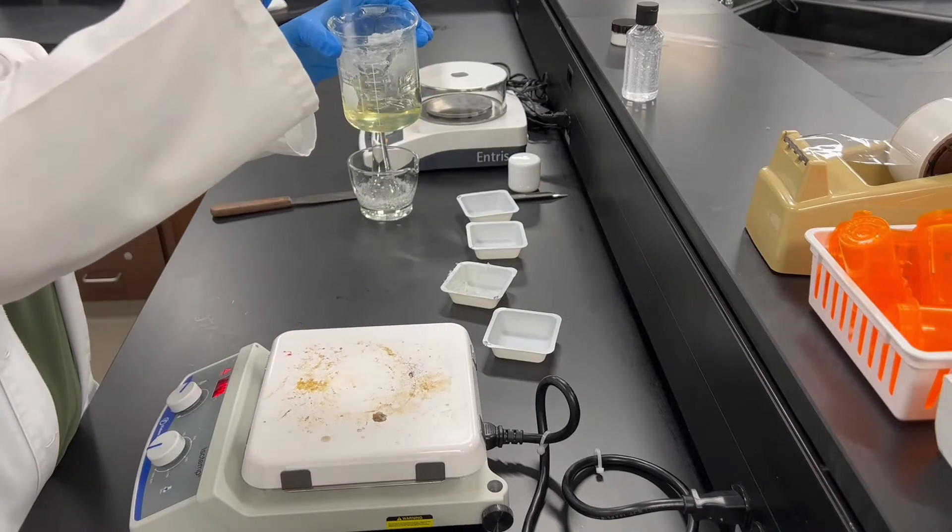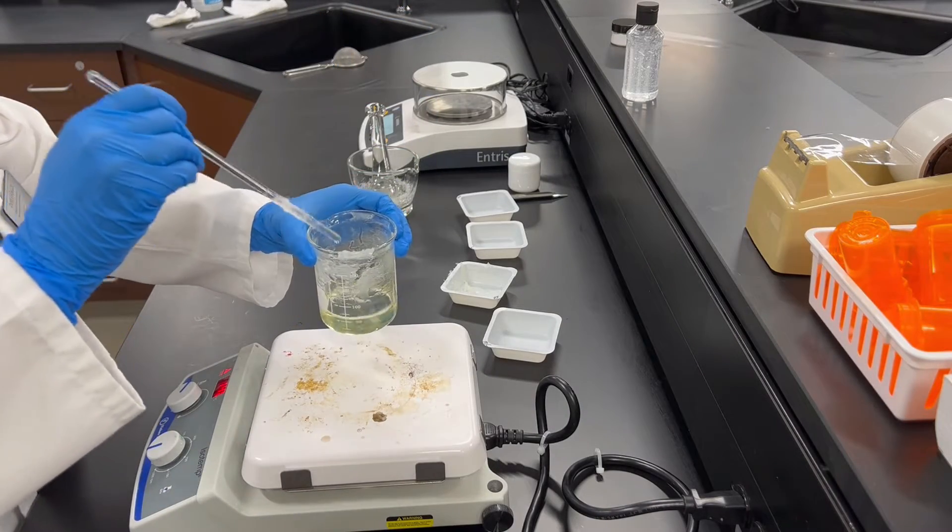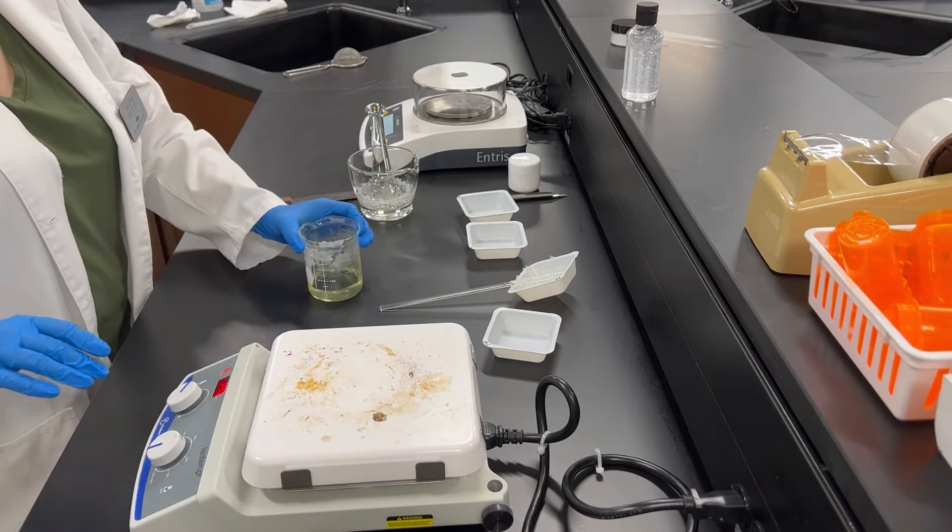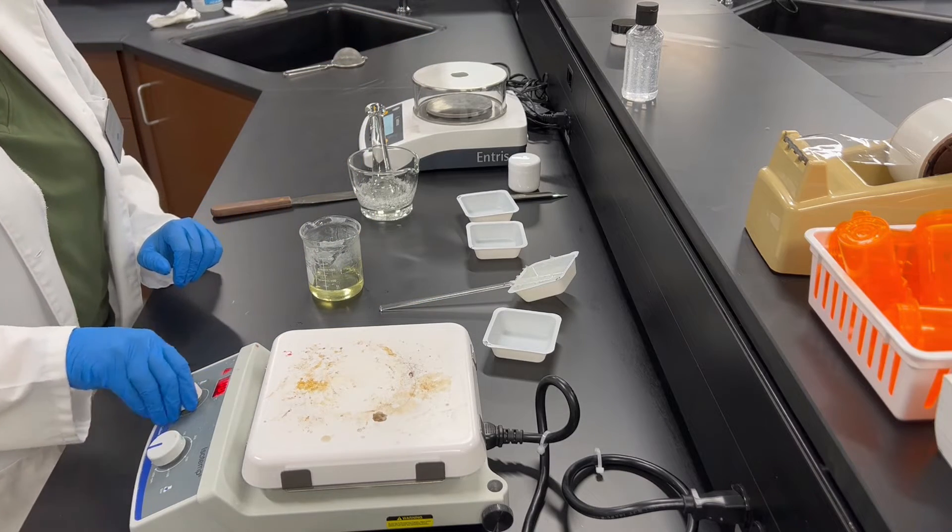Once you think you've got that good and mixed together and you have let your petroleum jelly and your wax melt, you can go ahead and take that off of the hot plate and turn your hot plate off because you will not need that anymore for this activity.